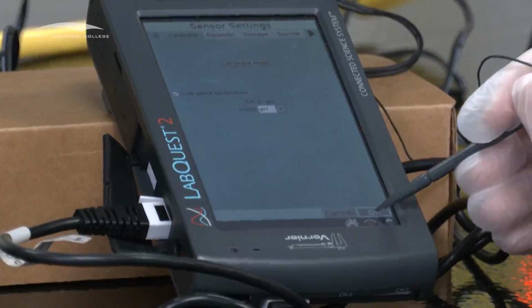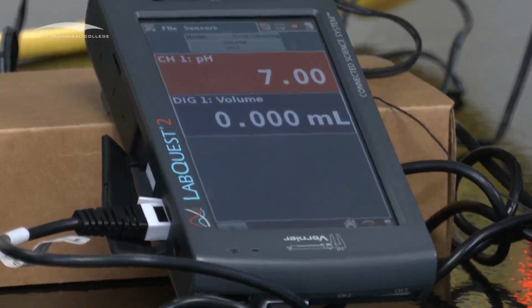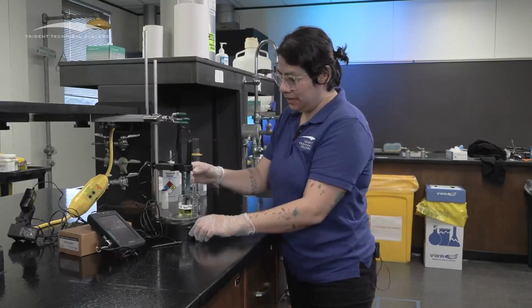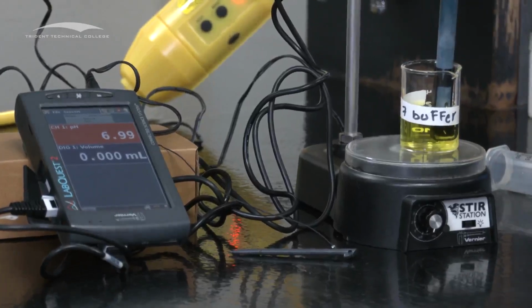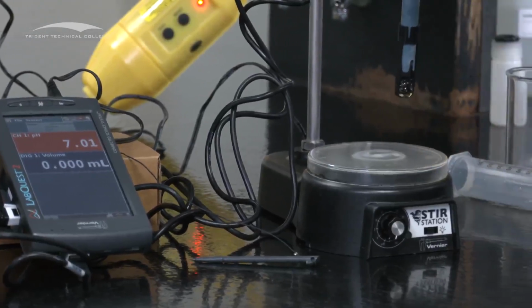And then now you can see the pH reads at 7, which this buffer is neutral, so it should read at 7. So we calibrated this one. I'm going to stop it. Again, don't move the drop counter. Once you have a drop counter height, that's it. Because if you start moving your drop counter, then we run into issues.